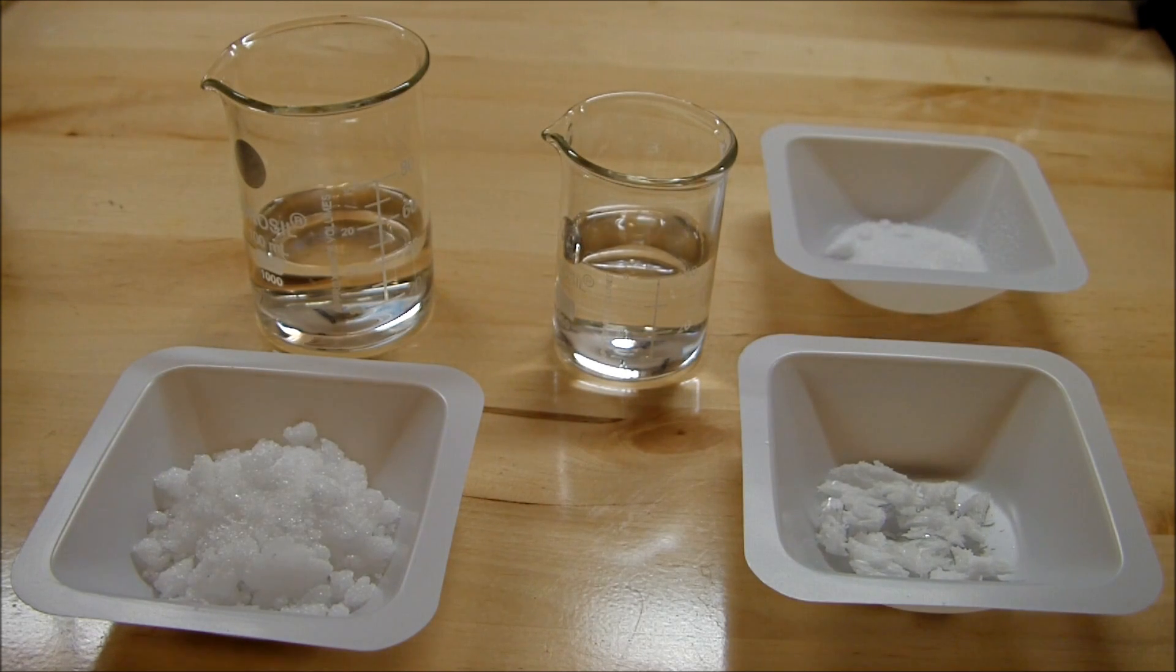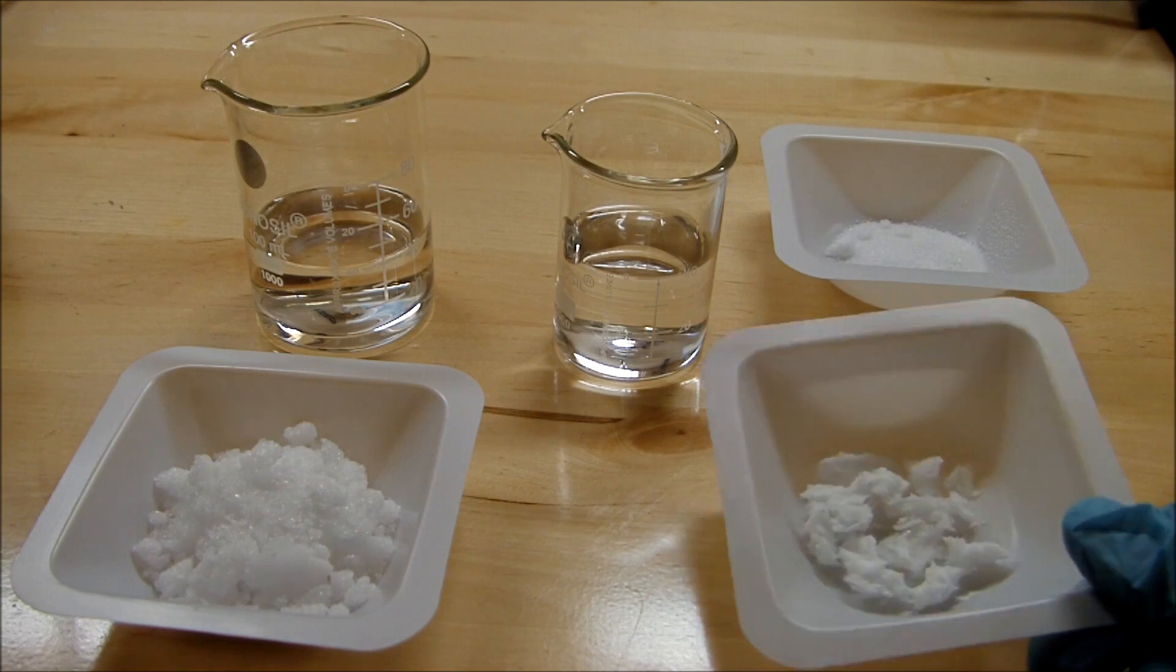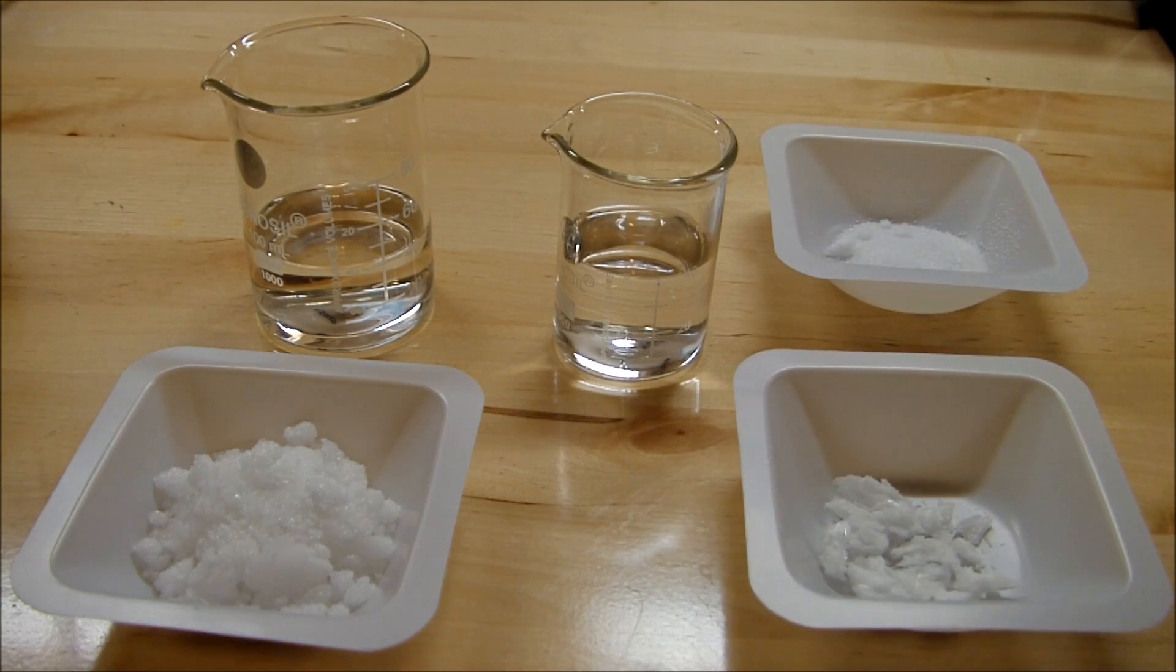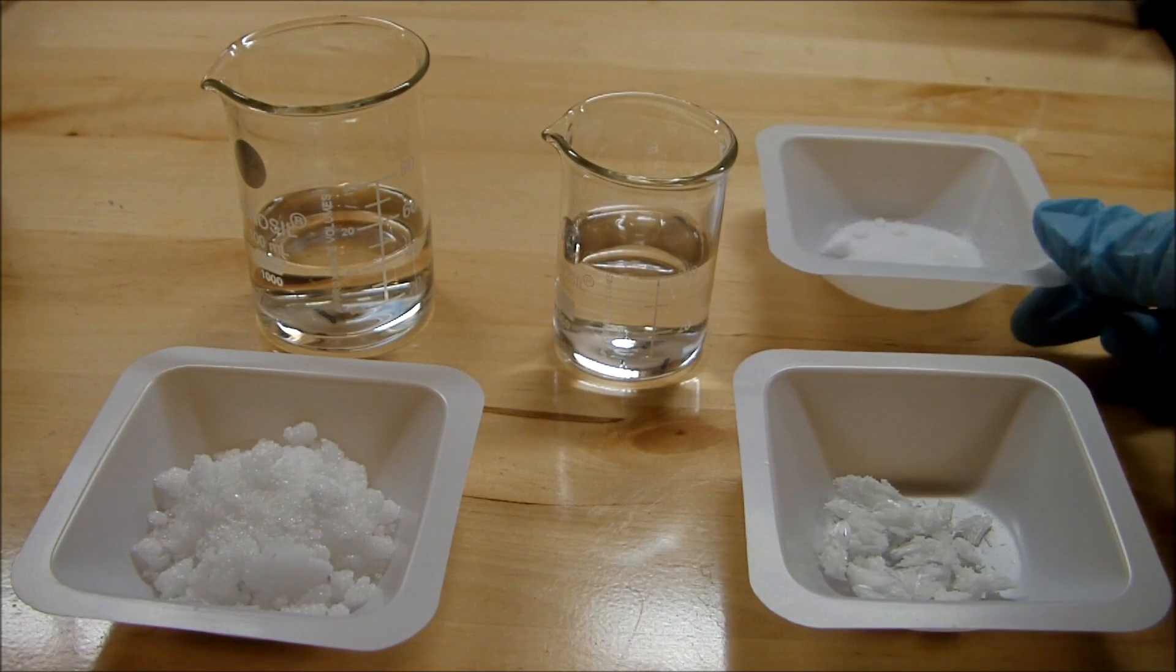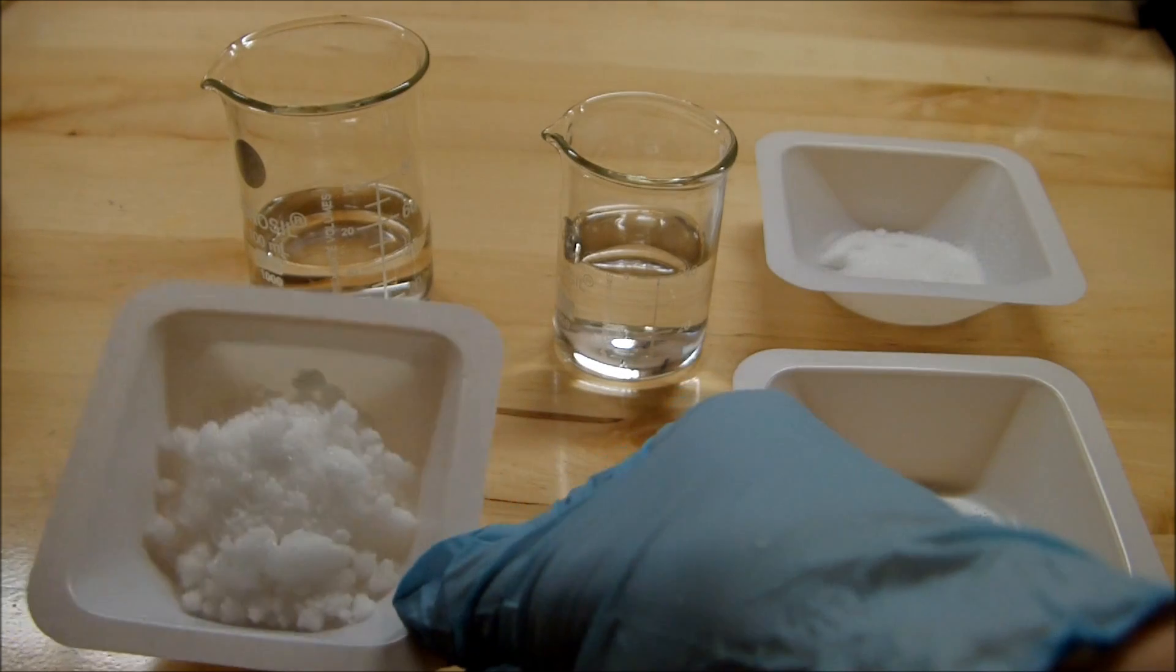The chemicals that I have are 2.5 grams of potassium nitrate that we made in a previous video, 2.5 grams of ammonium chloride that we made in a previous video, and 10 grams of natural camphor.